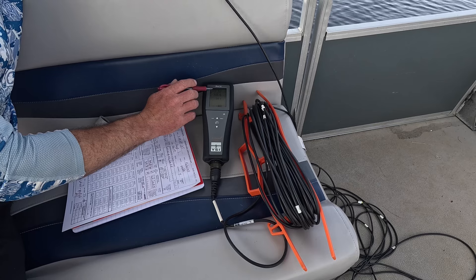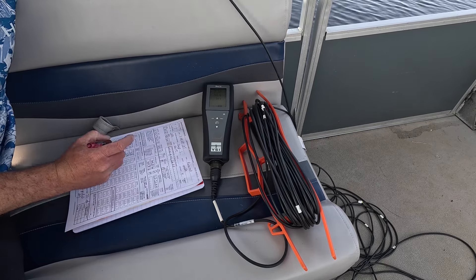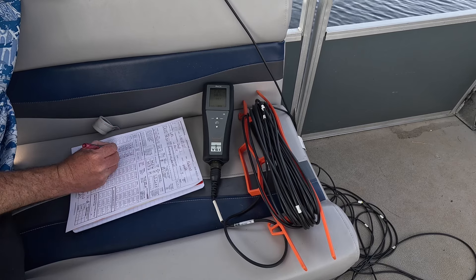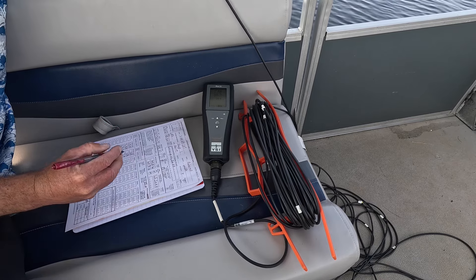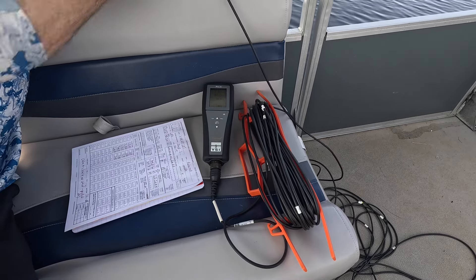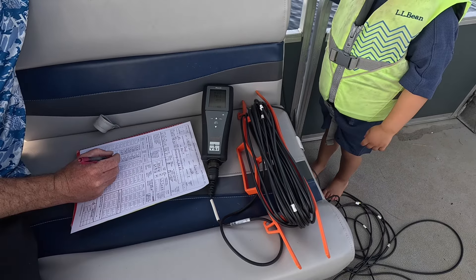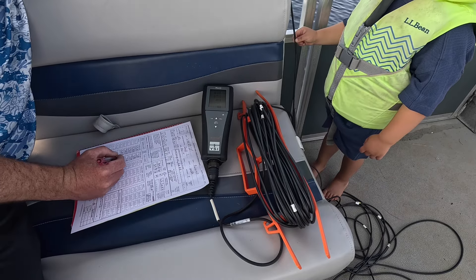As we go down, we give it a little shake. This meter requires a little bounce, just a wrist flip. We round up to the tenth — 7.4 milligrams per liter and 24.4 degrees Celsius. Temperature is staying pretty consistent, oxygen staying consistent. At 15 feet down, oxygen dips — as expected, we're in summer.